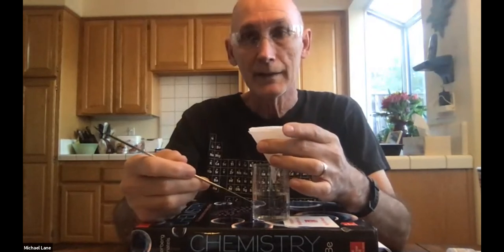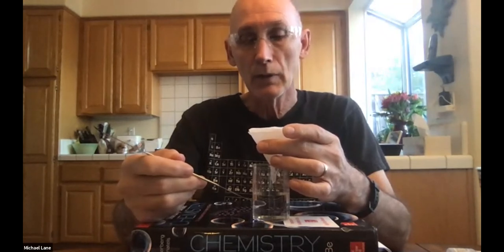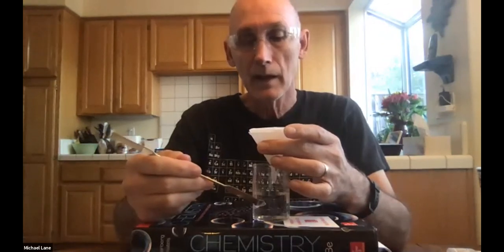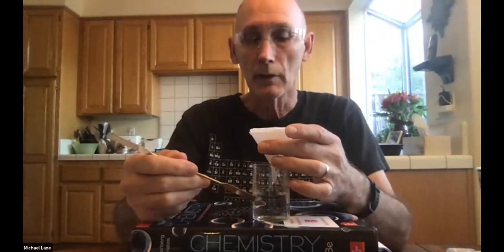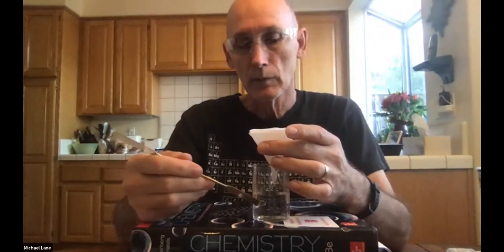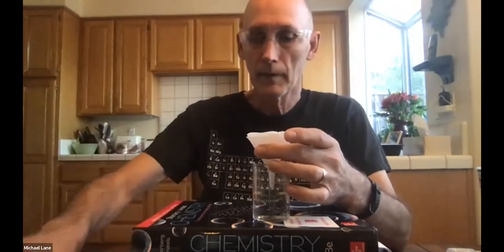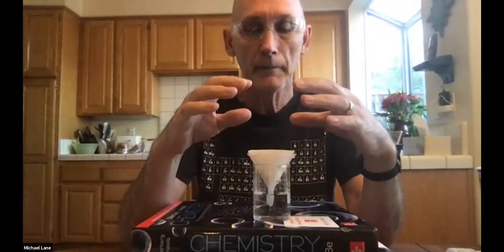Now we set this up so that the masses of each one are in pretty near stoichiometric equivalence, meaning they're the precise amount. So in theory anyway, this should be nothing but sodium chloride. And in fact, I'm sure it's really pretty close. So when we're done, we're of course just going to rinse this down the drain. Now, I'm going to sit this back down. And again, of course, I can't tip this up for you to see it, but it's effectively fully filtered.